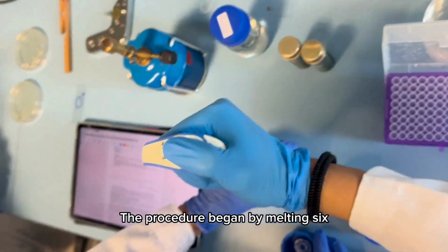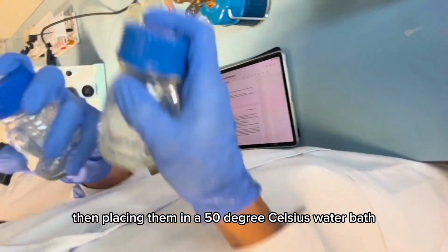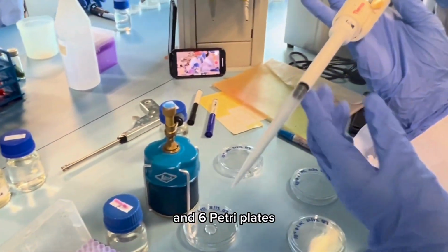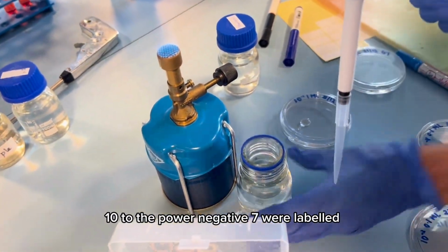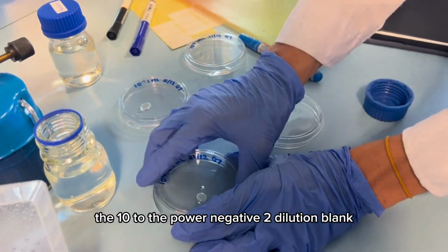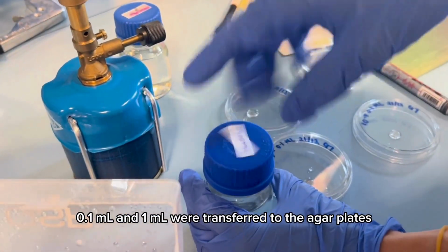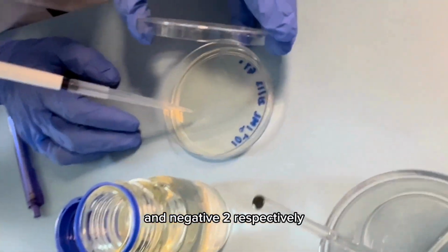The procedure began by melting 6 nutrient agar deeps in a boiling water bath, then placing them in a 50 degrees Celsius water bath. 3 dilution blanks, which were 10 to the power -2, -4, and -6, and 6 petri plates, which were 10 to the power -2 through 10 to the power -7, were labeled. The unknown sample was shaken and 1 ml was transferred to the 10 to the power -2 dilution blank, which was vigorously shaken. From the 10 to the power -2 dilution, 0.1 ml and 1 ml were transferred to the agar plates labeled 10 to the power -3 and -2 respectively.